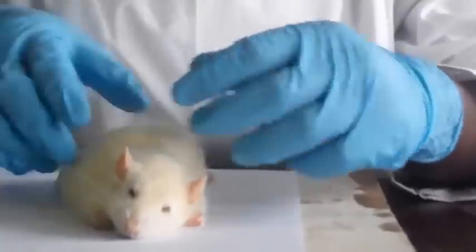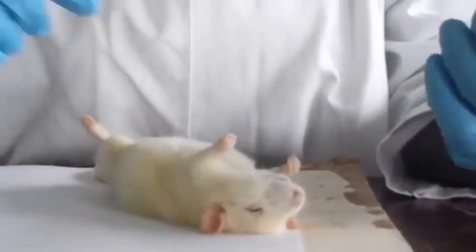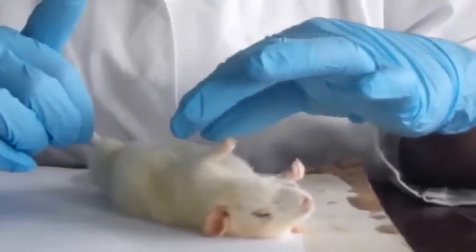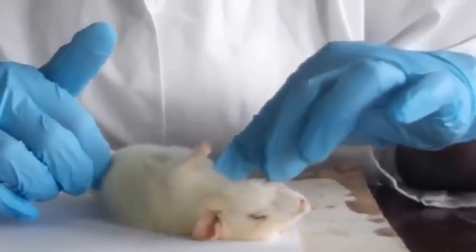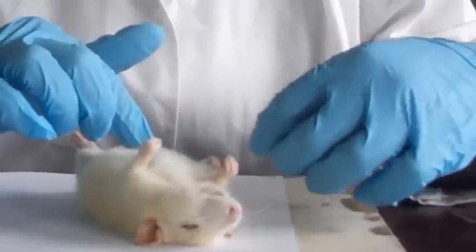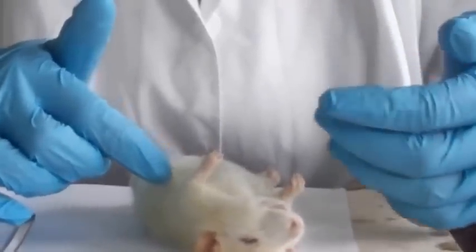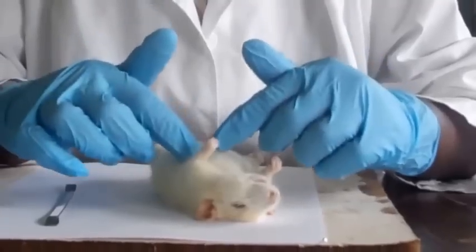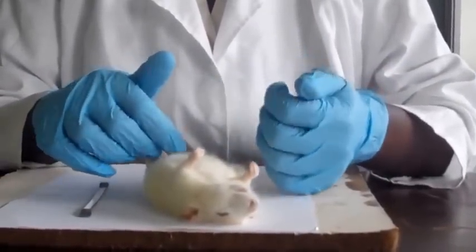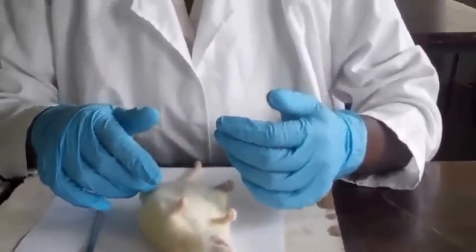And then we have the trunk region, which is divided into the thorax and the abdomen. The thorax and the abdomen make up the trunk. Whereas the abdomen is yielding, the thorax is firm. This is because of the rib cage in that area. The abdomen is yielding to give enough space, just in case it has eaten enough food, and to be able to stretch.